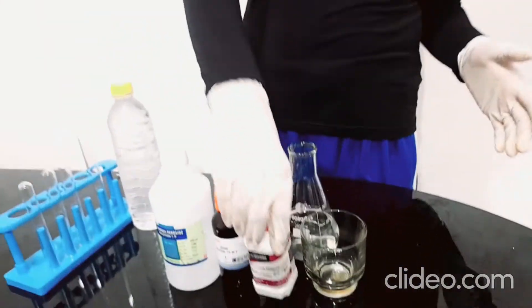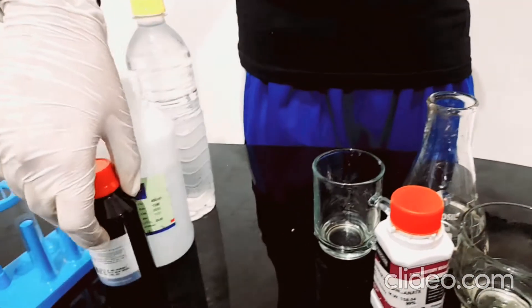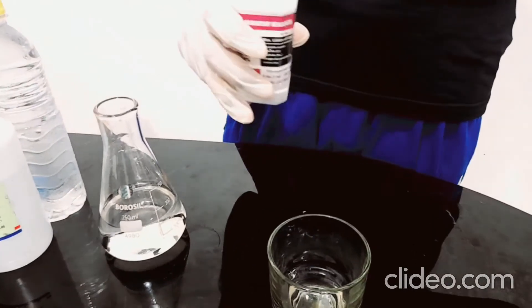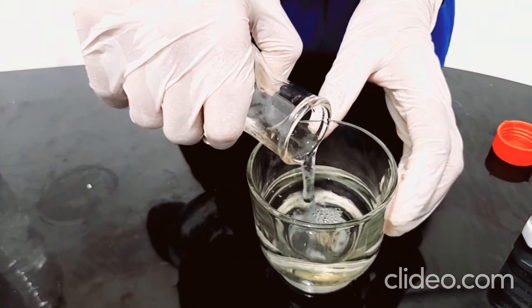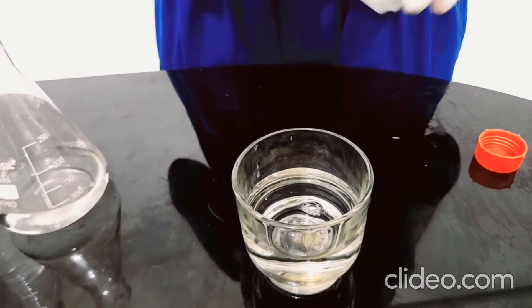For the first experiment, I have a special ingredient. Let's move the rest of the ingredients for the second experiment aside. I have a bit of water in this glass and we have potassium permanganate. I've taken a spatula. I have water in the beaker so let's pour a bit into it — I don't need it completely filled because I need to add an extra ingredient and it should fit in there.